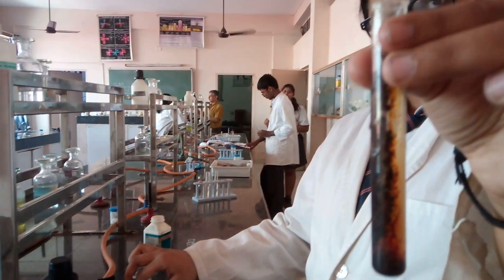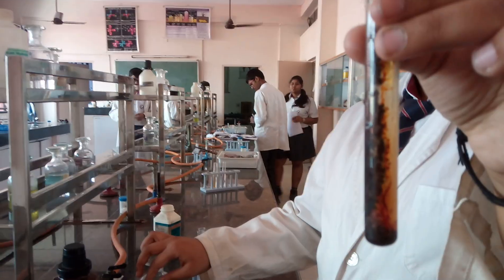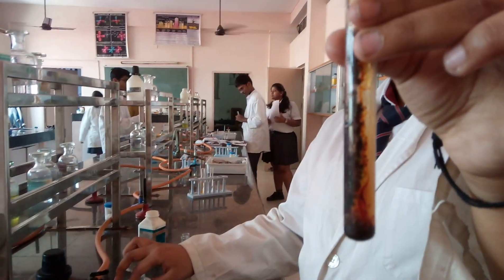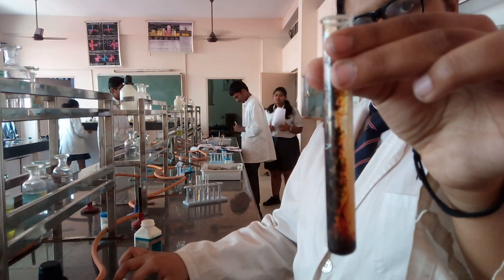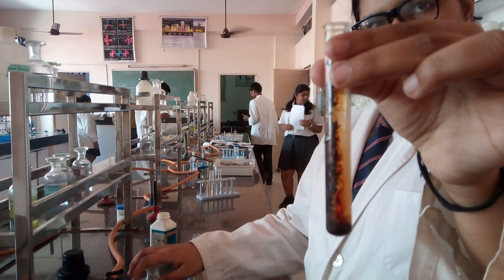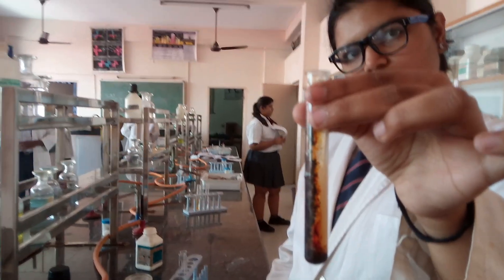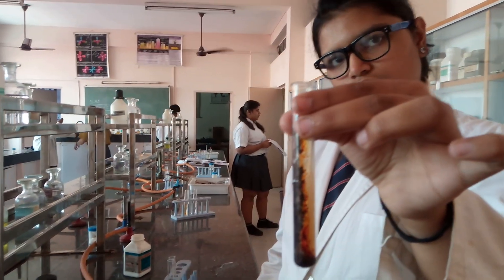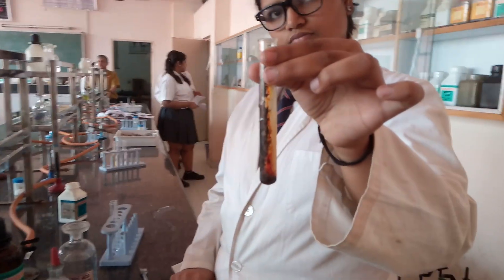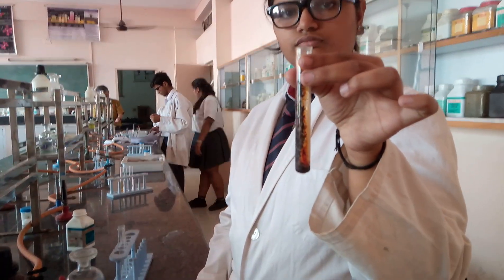You cannot confirm at this stage whether the gas is bromine or iodine. You need to confirm it through the organic layer test. But for sure, one out of the two — bromide or iodide — is present. One of the two gases, either Br₂ or I₂, is being formed by the sulfuric acid, which acts as an oxidizing agent, able to oxidize iodide to I₂ or bromide to Br₂.